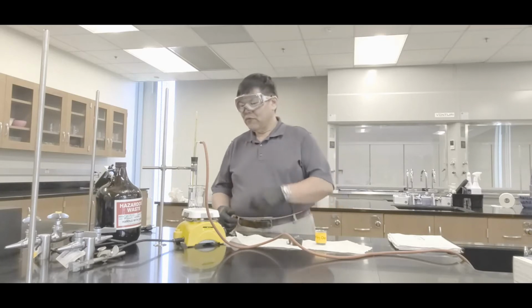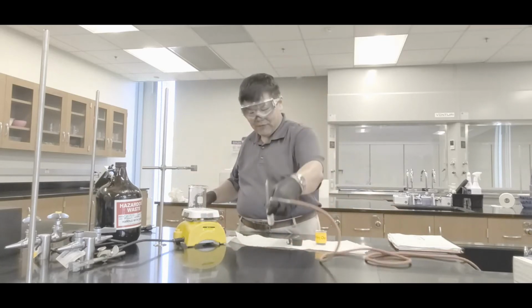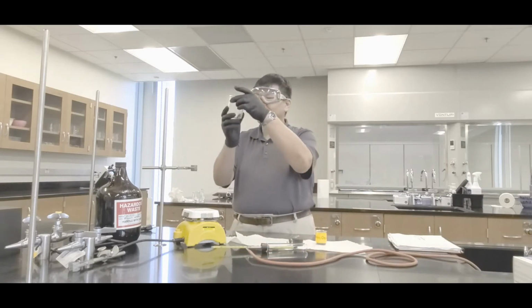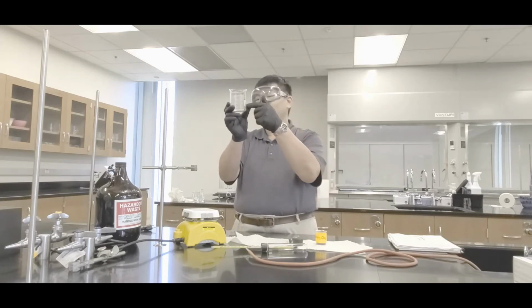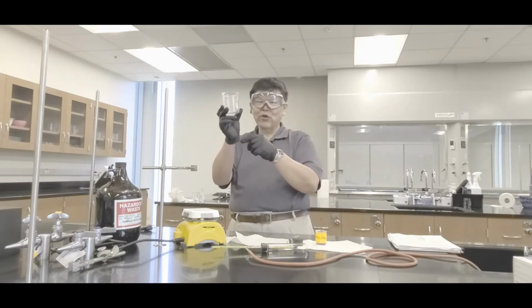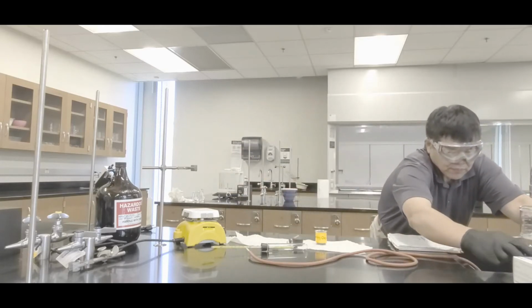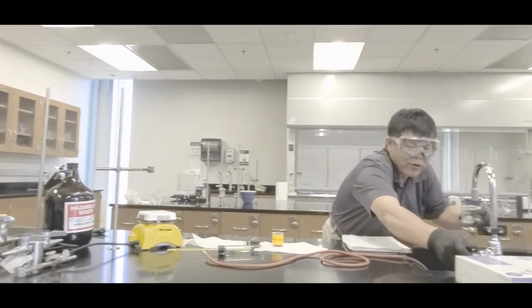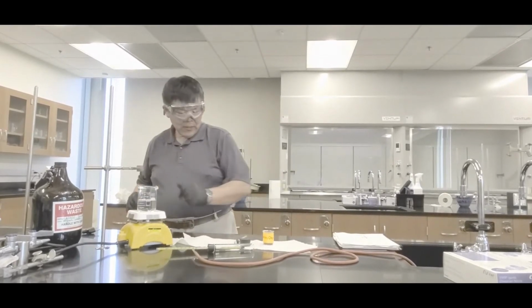So, first thing, let's take this guy off, the boiling point apparatus, take that off. Now what you want to do is that beaker right there, I'm going to fill it about, say, a third full of tap water. Okay, don't waste the still water on that. So here we go. You don't want too much water because the more water you got in there, the longer it takes to boil. So park that here.